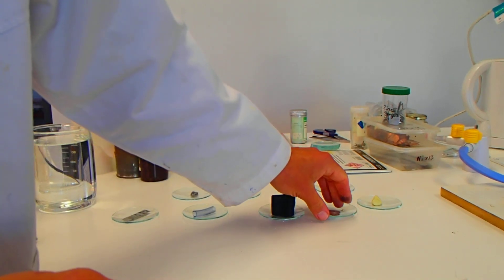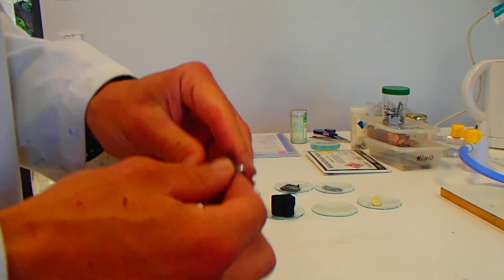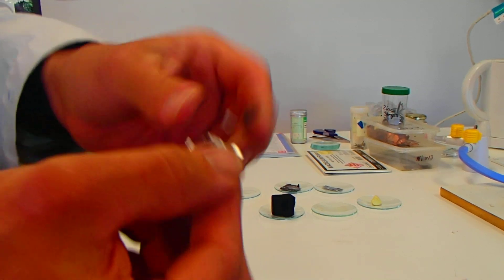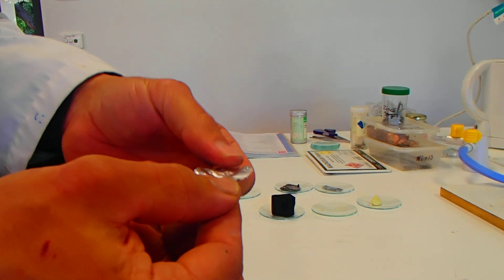Look at aluminum. It does not take its original shape. Once I bend it, it stays bent. So that might be a key difference between aluminum and silicon.